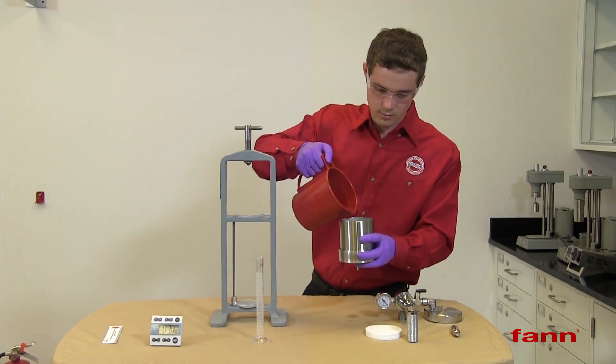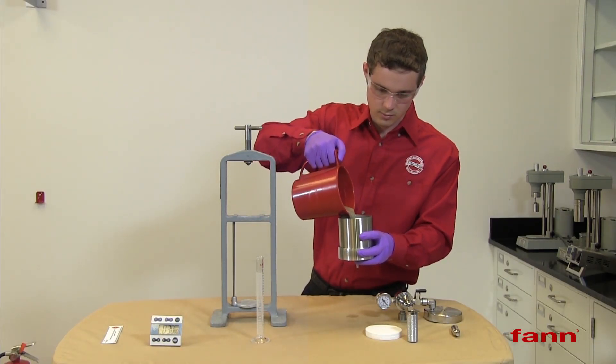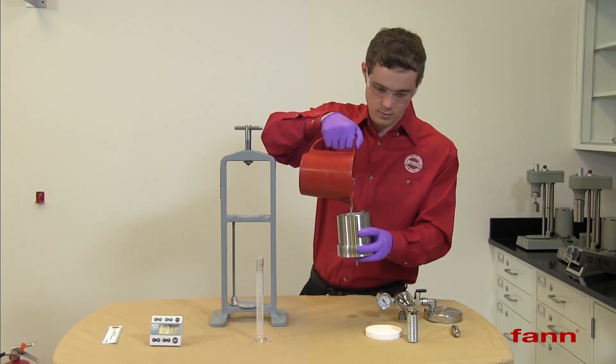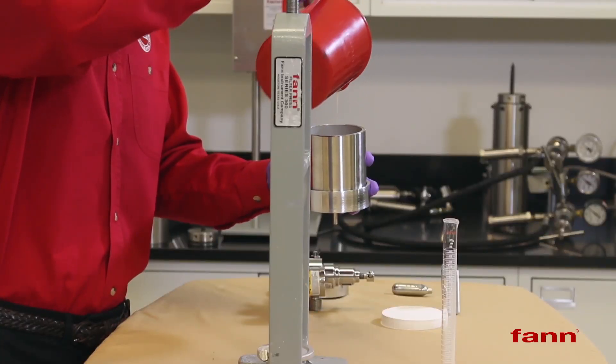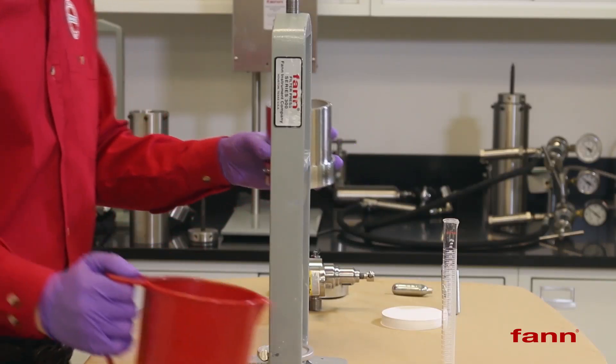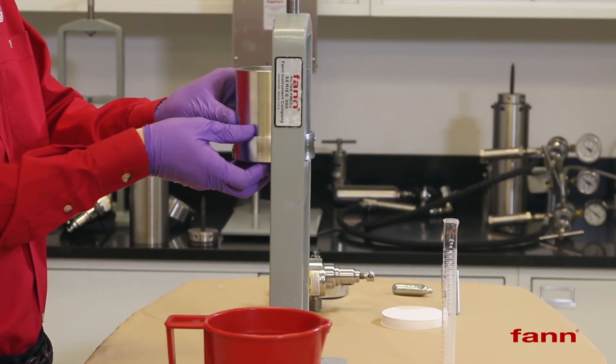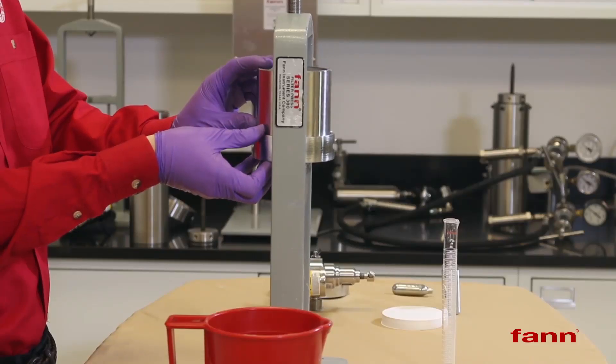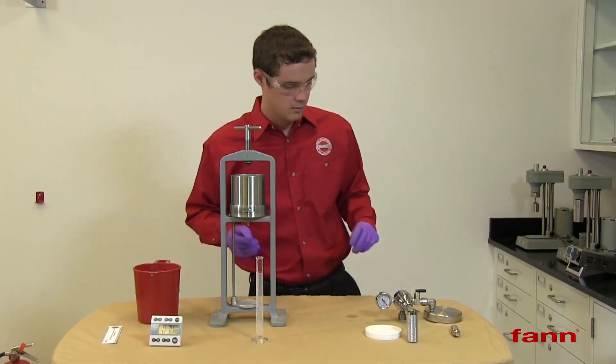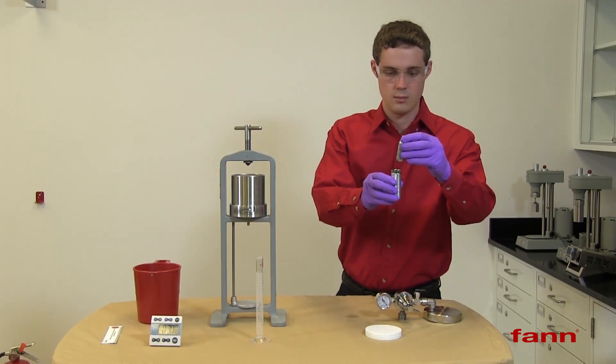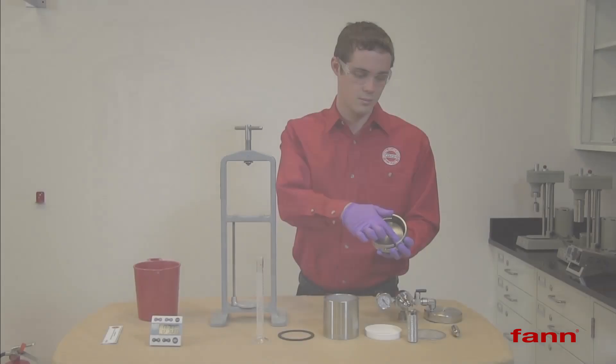Pour in a sample of drilling fluid to be measured. Put this assembly in the frame. Install a CO2 cartridge.